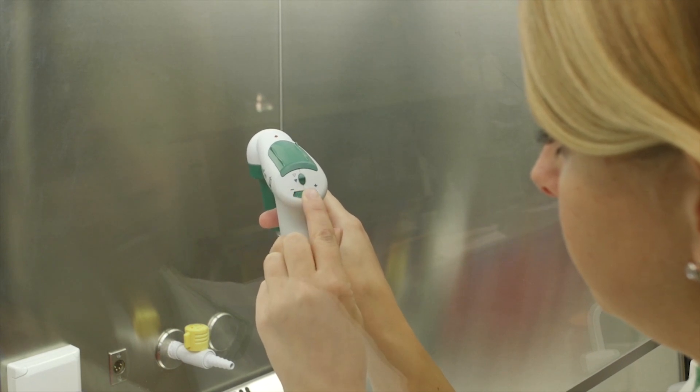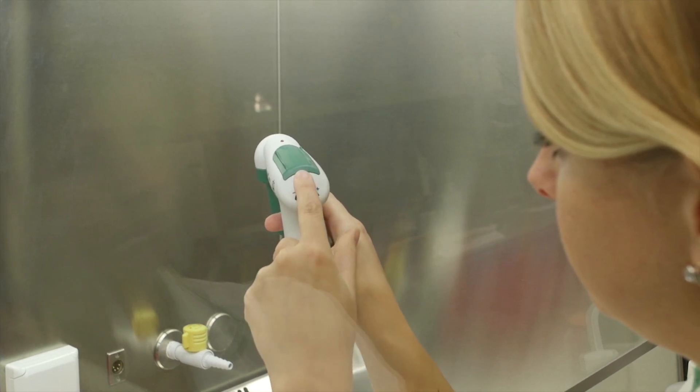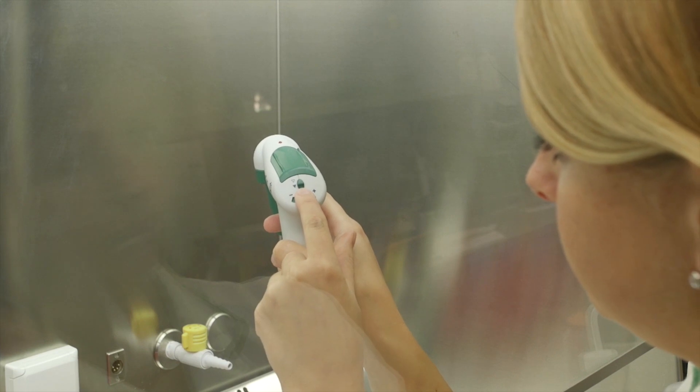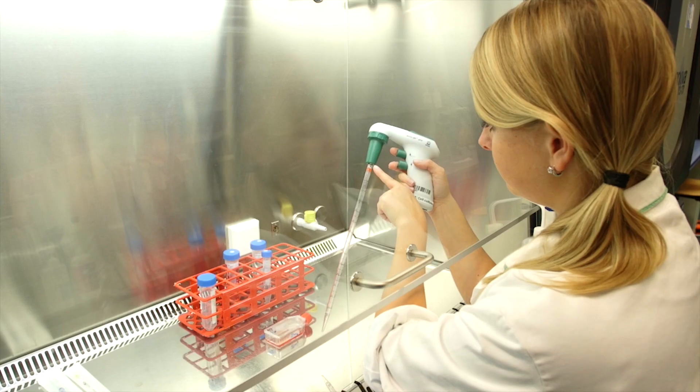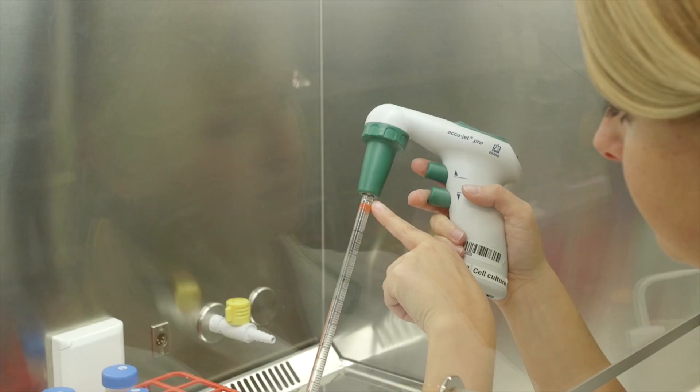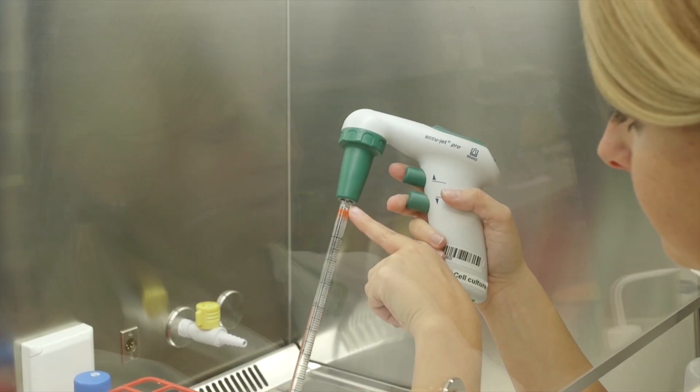If liquid is not coming out well, check that this button on the back is pushed down. When pipetting, always make sure that no liquid enters the pipette boy. If by accident liquid does enter the pipette boy, inform your teacher immediately.